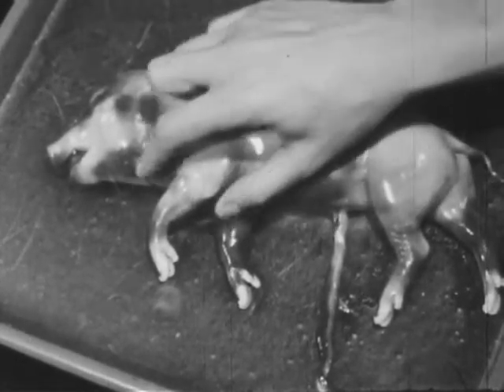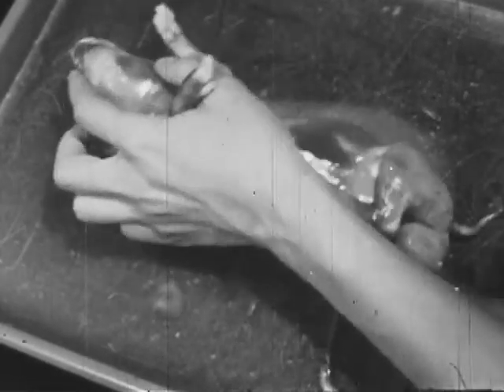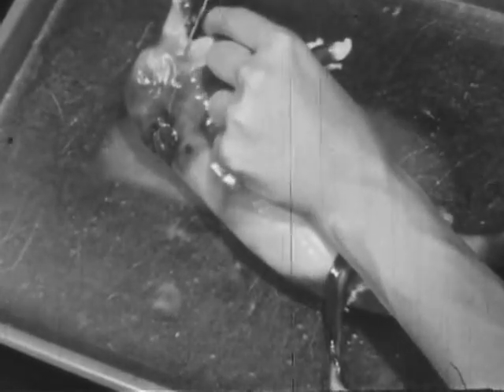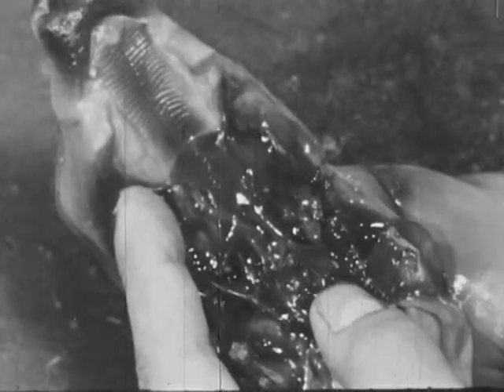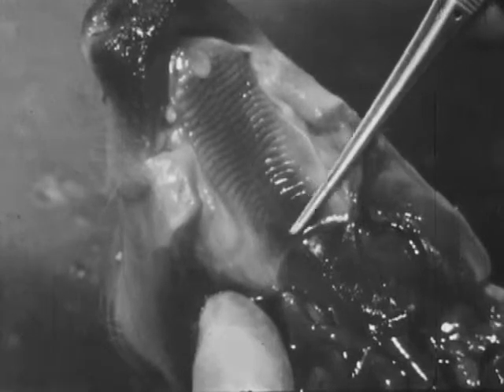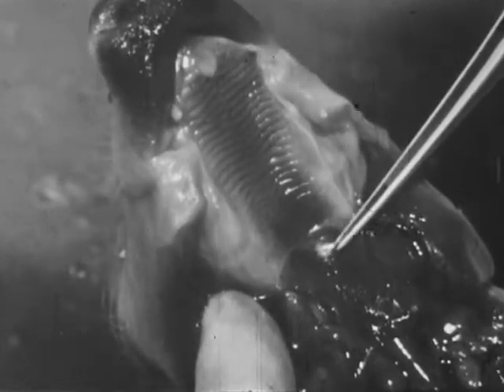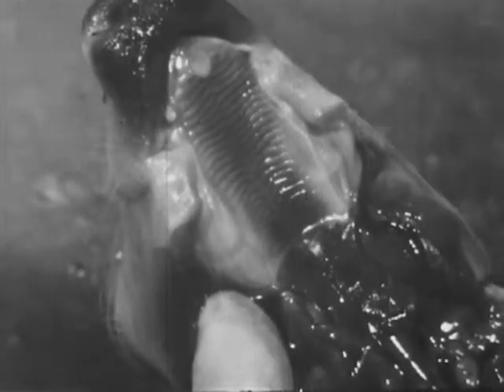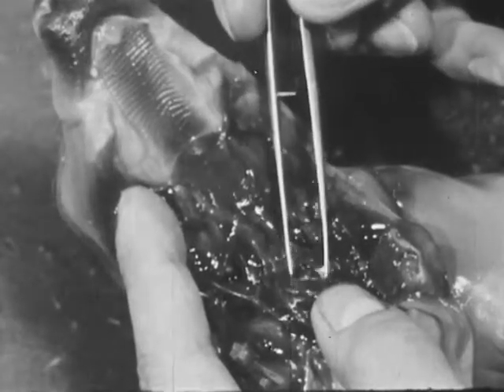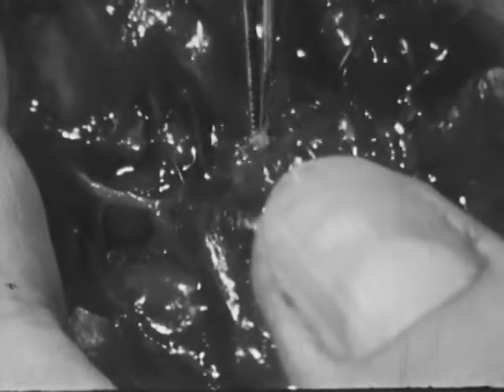We will now examine this larger fetal pig whose anatomy is very similar to your own. Cutting the angle of the jaws permits a clear view of the mouth cavity. The roof of the mouth cavity consists of the bony hard palate and the fleshy soft palate. Behind the tongue is the respiratory opening or glottis, which is covered by the epiglottis when swallowing.